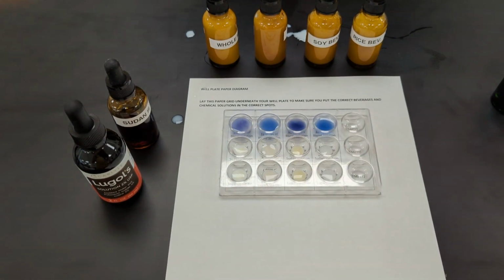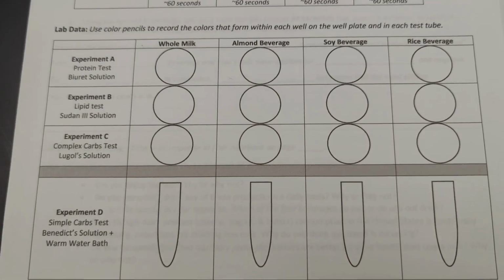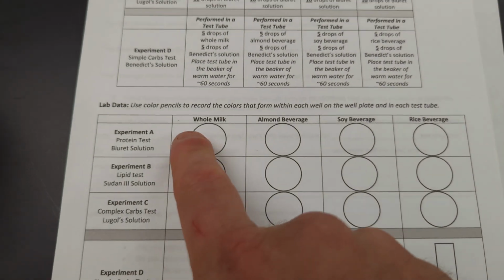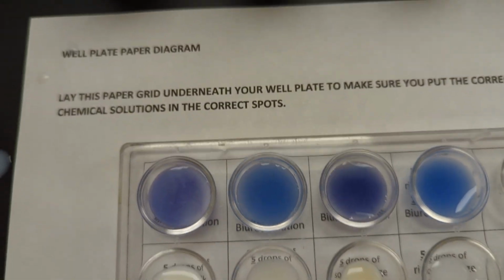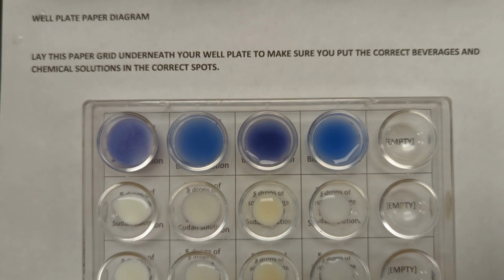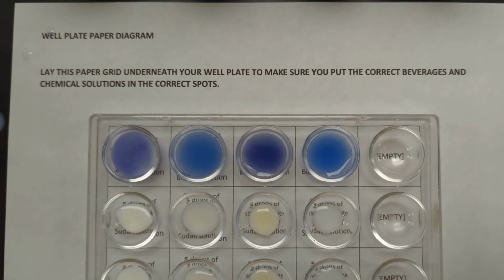All right, so what you will want to do in your data table is draw or color what color changes you see. If the solution turns from a blue to a violet color, that indicates the presence of proteins. So again, you can look at this video to make that determination. If you see proteins present in these 4 beverages.